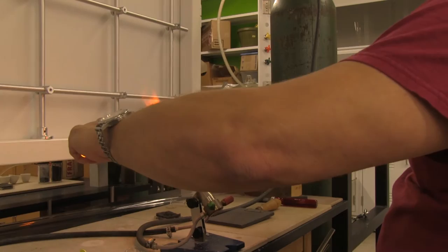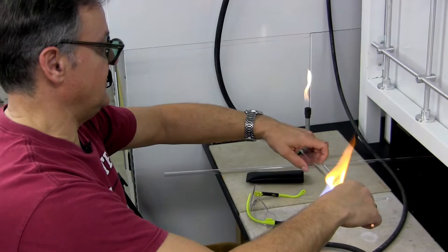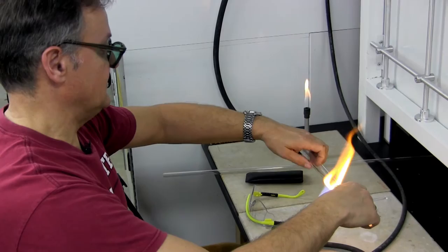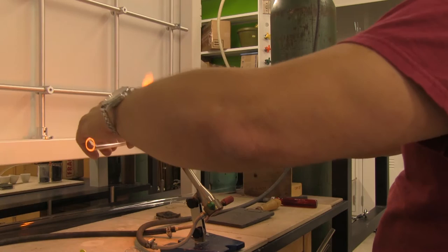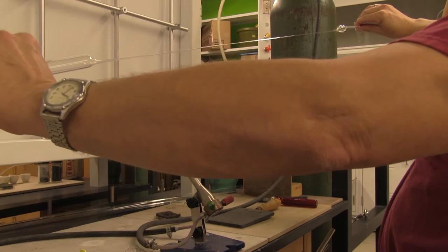Now we need to work to get some sort of handle because we will need to stretch it and make a needle. The trick is to make even rotation, which takes some practice to provide even heating of glass because you don't want to overheat one part versus another. Then you gently pull it and that's how you make a needle or the area handle to make the ampoule.